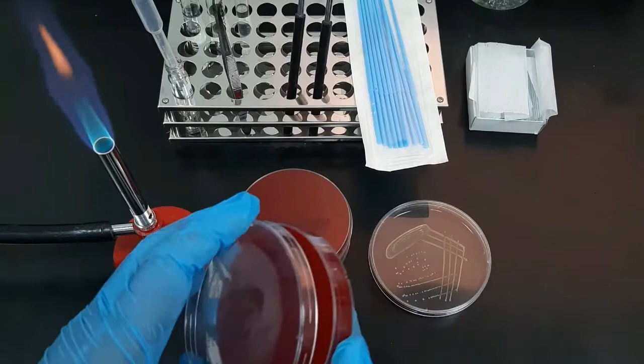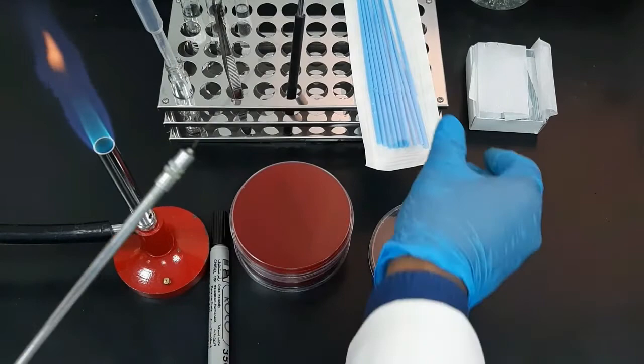An old bacterial culture plate, a fresh culture media plate or a liquid culture, Nichrome wire loop or a disposable plastic loop, and a marker pen.